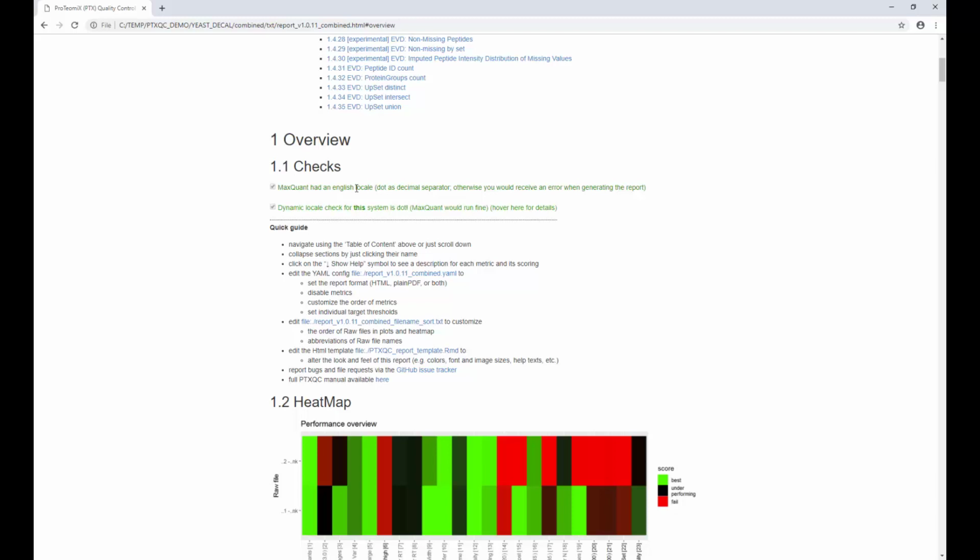So the very fact that we can see a report means the MaxQuant run was done using an English locale. The second thing that every report will show you is what is the system that I'm running this browser on. Is it correctly configured? Meaning, does it have an English locale, and could I run MaxQuant on this? And the answer here is yes, you can. If at some point this turns red, do not run MaxQuant on this very system where you're executing the browser on, or change your locale first before running MaxQuant, because otherwise the MaxQuant results will not be useful. Okay.